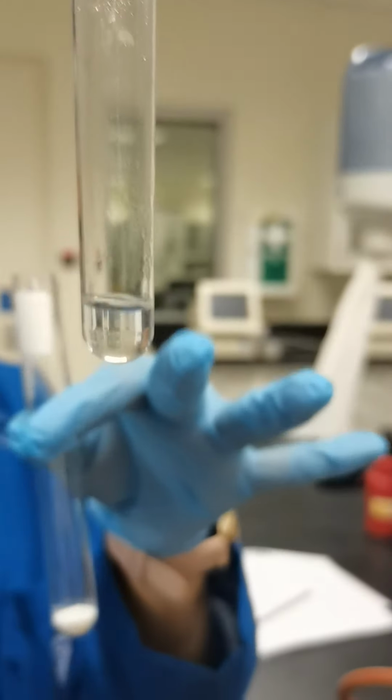Test tube A with sodium bicarbonate, we dissolved with HCl, and now it's a clear solution. In the same way we will add the 6 molar HCl to test tubes B, C, D, E, F, and dissolve and make clear solutions. Then we'll show you the end result.